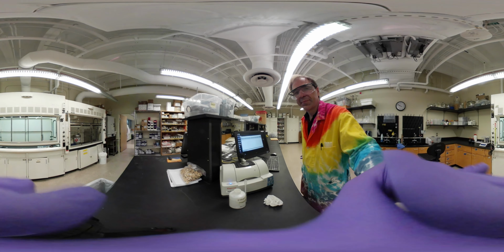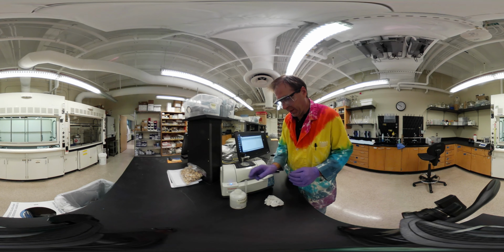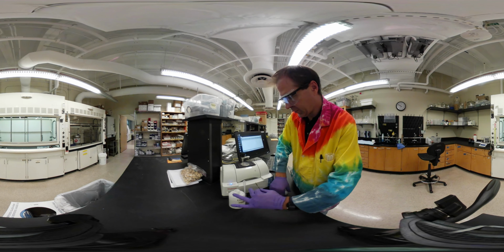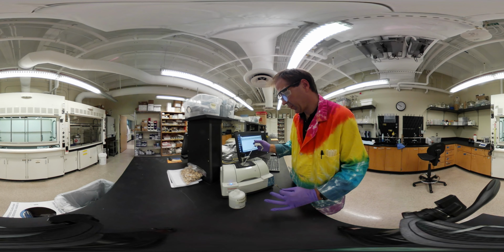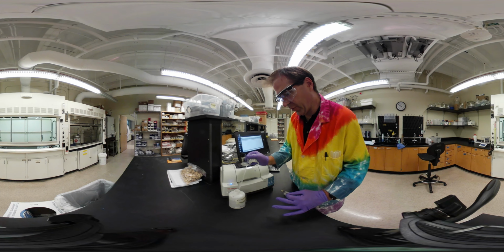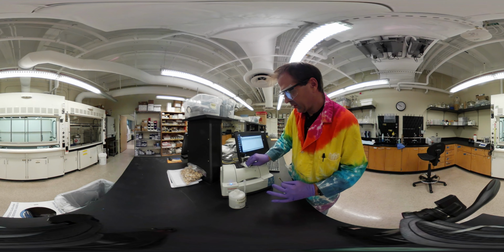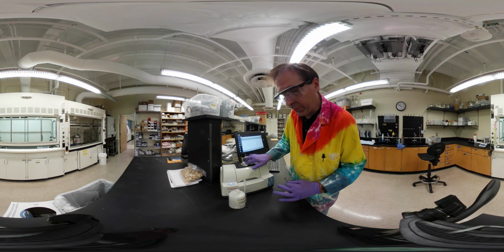I'll be right back. And I'm back. All right, so we got to clean this off, and we clean this always with ethanol. Get rid of most of the materials on its own. Put a little ethanol. You have to be a little careful with that. Make sure it dries before you take the spectrum, because you will then have a very large ethanol peak, which you don't want.